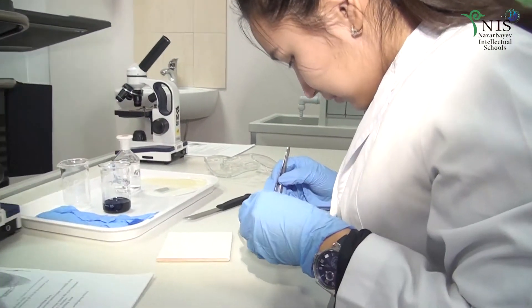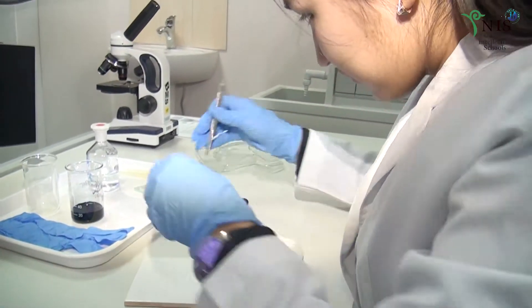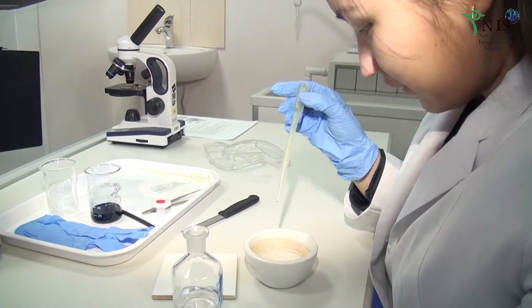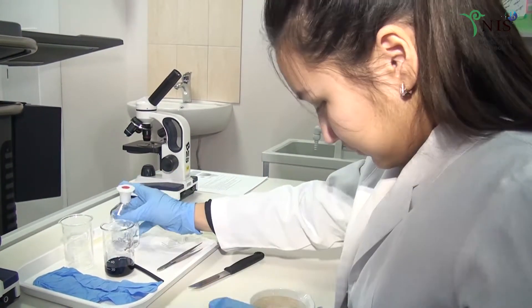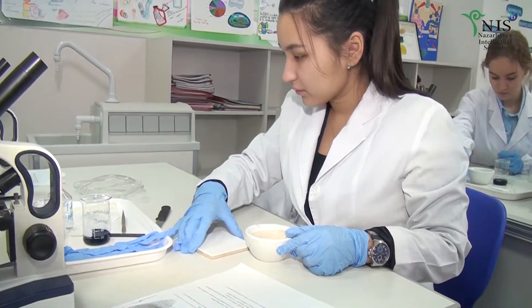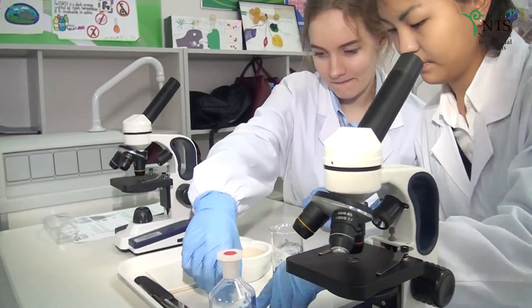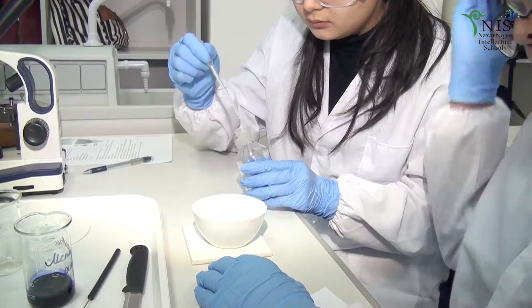Use the needle. Add a few drops of hydrochloric acid and wait for five minutes. These roots should be in the hydrochloric acid. You need to wait five minutes.